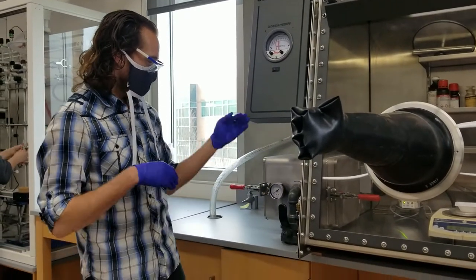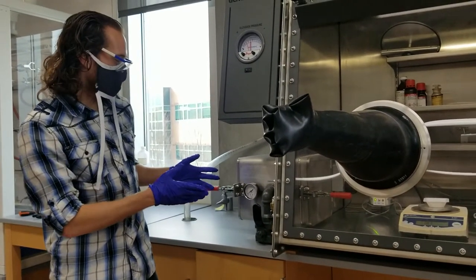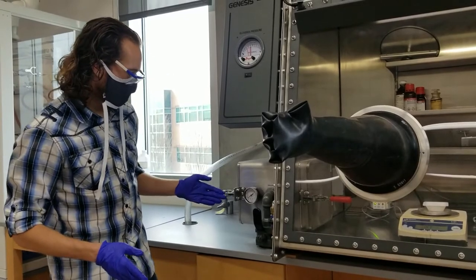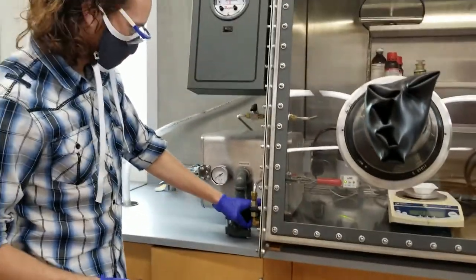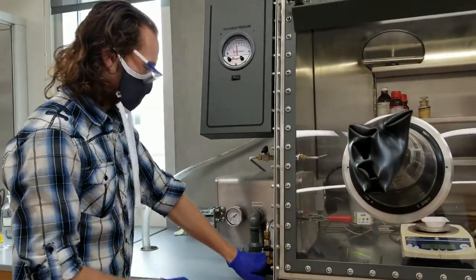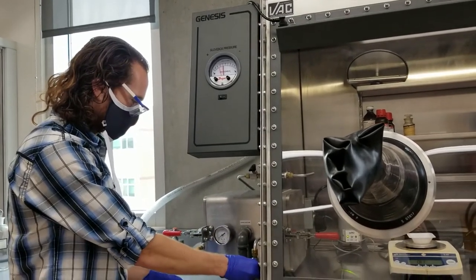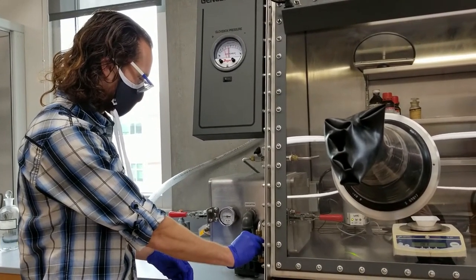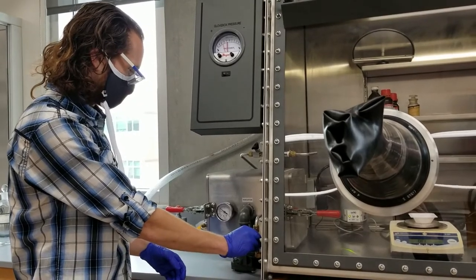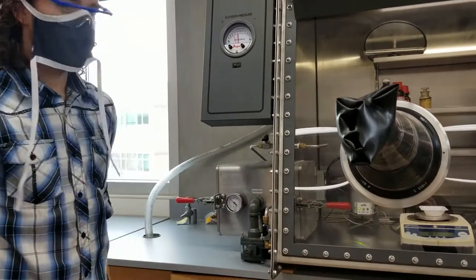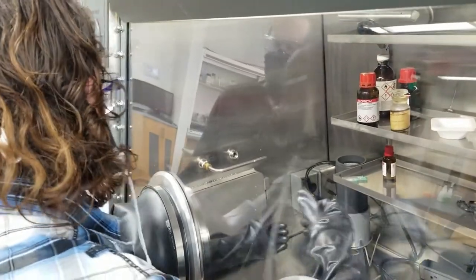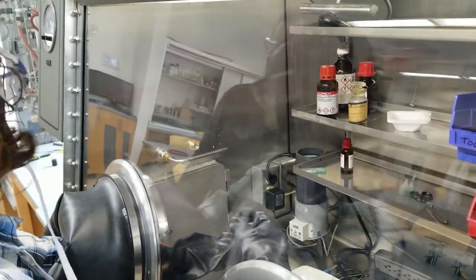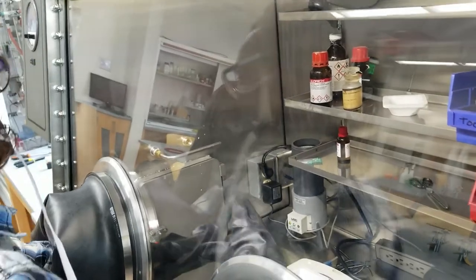So now we're back. We have done with our third evacuation with the vacuum. So as you see, it's open right now. And we are now going to close it for the last time and open it up to the atmosphere inside here.